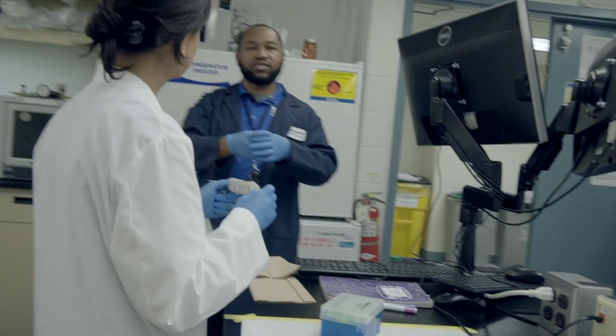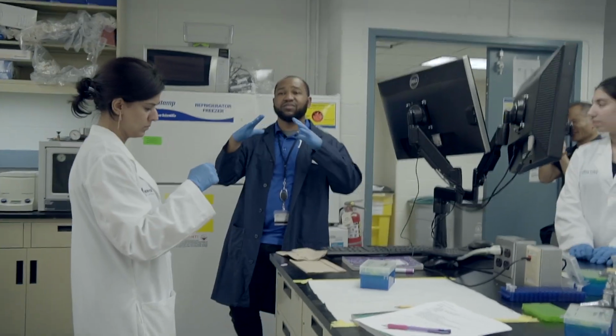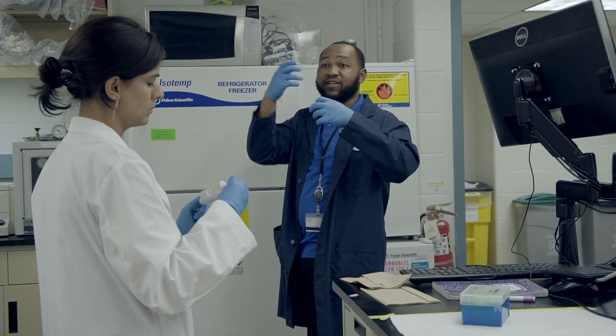Another note as well: Kirthi and I both use containers similar to each other. She had a flask, I had kind of a bottle. Whenever you're doing this, because you have to heat it, it's very important that you use something that is necked at the top, because you're heating it and you don't want it to bubble over. So if you use a beaker where the diameter is the same, it might spill out while it's heating.